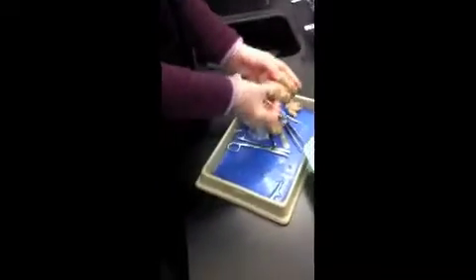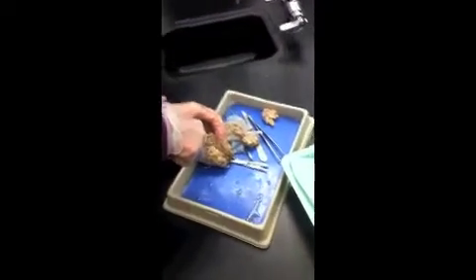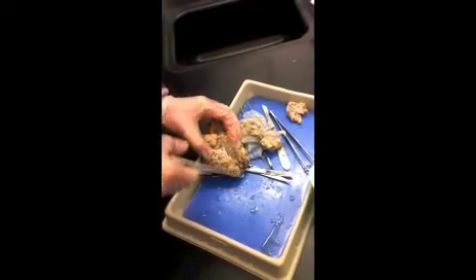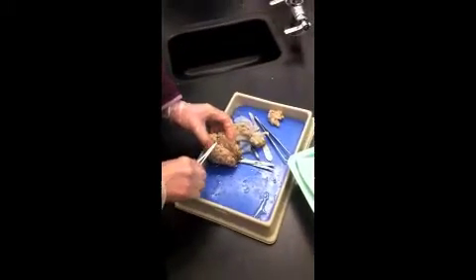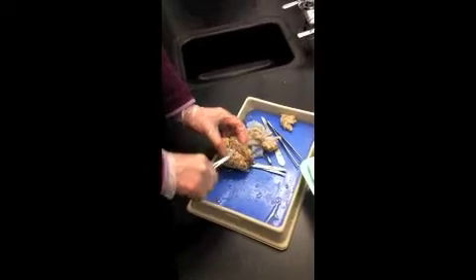See this white area? Remember, white matter in the brain is myelinated nerve fibers, and these fibers run transversely from one hemisphere to the other.